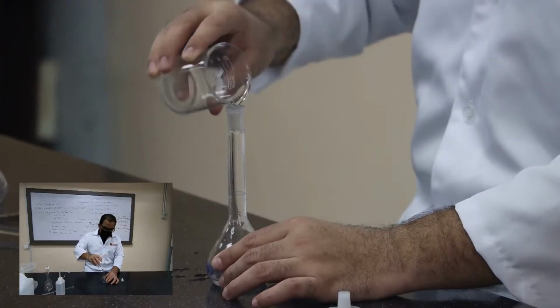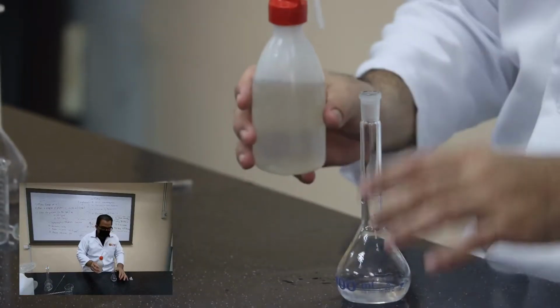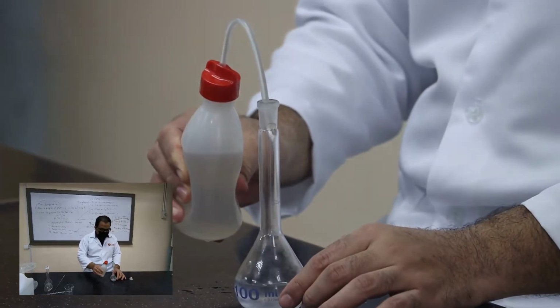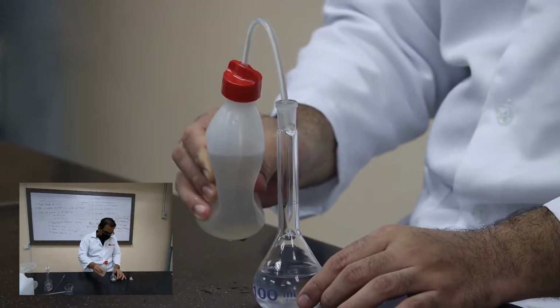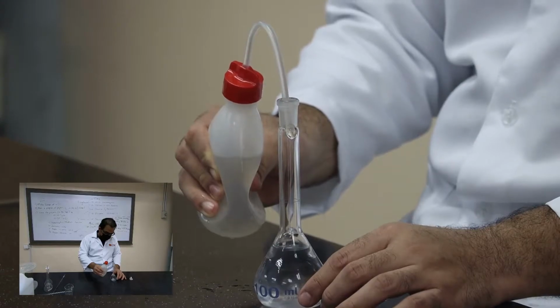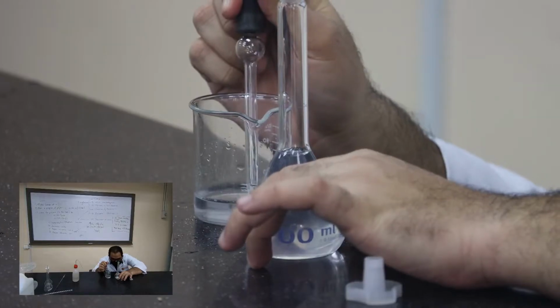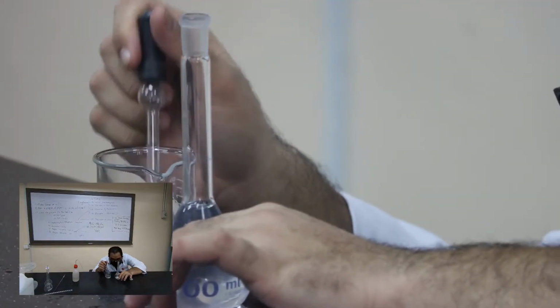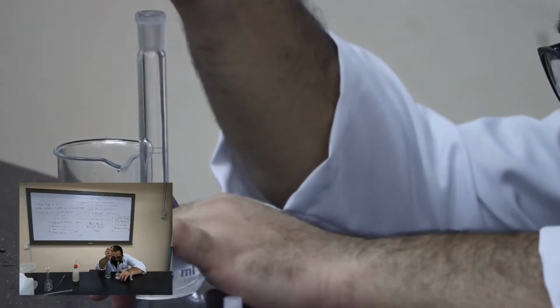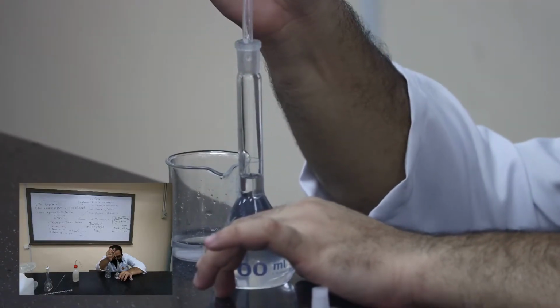This is how it is going to be done. Then we add distilled water, deionized distilled water, into the volumetric flask up to the mark. We have to be very careful. We have to make sure that we have eye level observation. Now, since it's coming to the mark, I have to stop it. I have to make sure that I am at the level. Now I'm transferring a small amount of deionized water using the dropper to make sure that the meniscus attains the mark that I want.